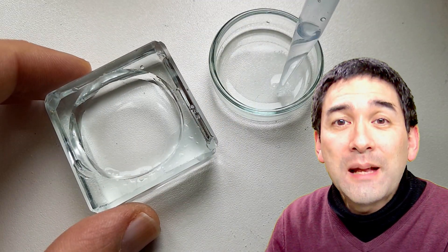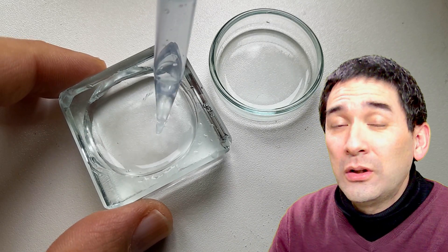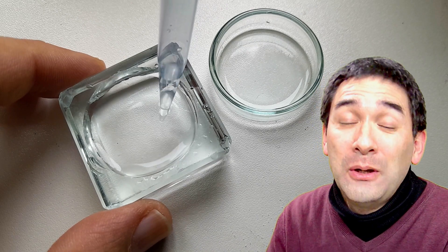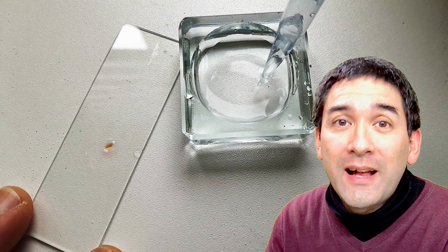What I'm doing here right now is I'm adding a little bit of alcohol to some water. I'm diluting the alcohol, otherwise it's way too concentrated. I do not want to harm the Daphnia, so I want to use an appropriate concentration of alcohol.